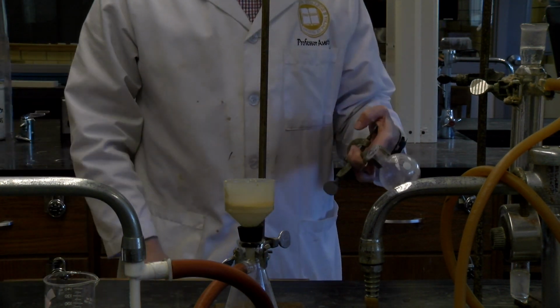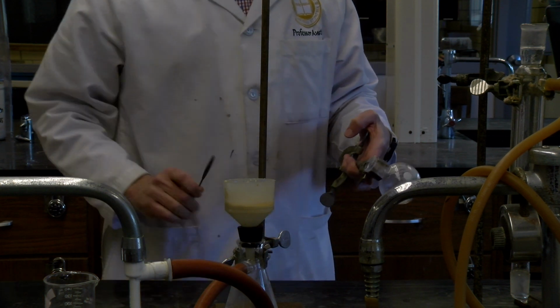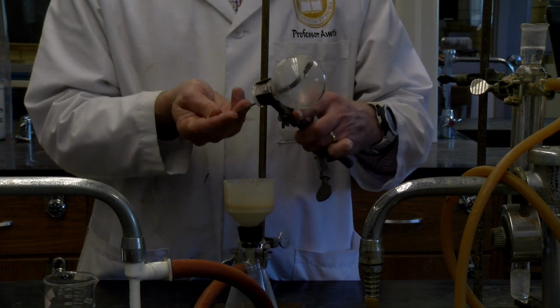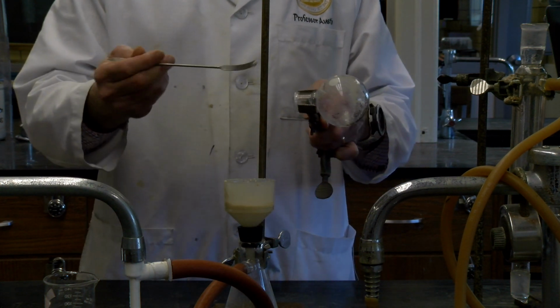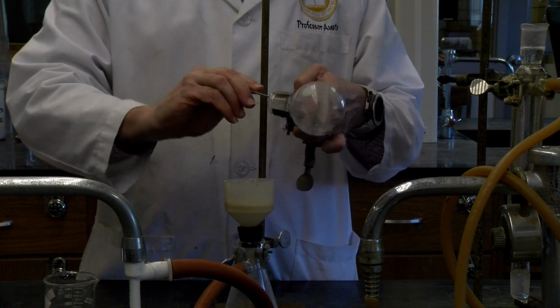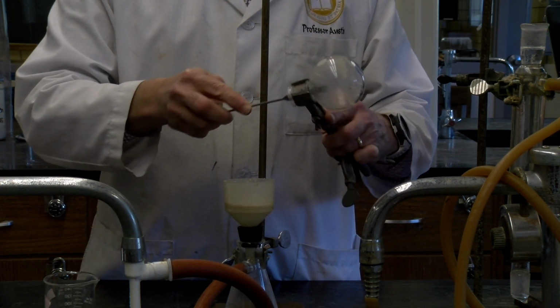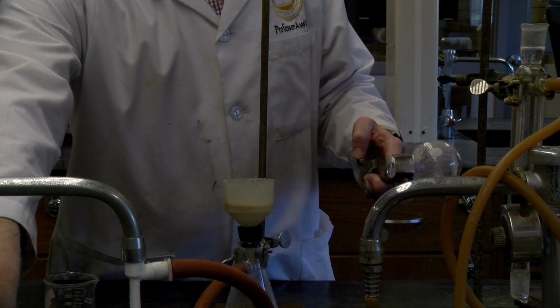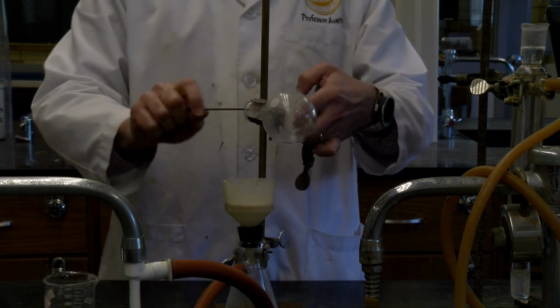And so then we also want to make sure we're getting the crystals and some of those. And so I will endeavor to scrape these guys off. And so again, a good thing to do is always use sort of a curved one of these. That's a good help for getting crystals out of a round bottom. Many of you have worked with this. All right, and so let's go ahead and get a few more of these crystals, and that'll help with the filtration.